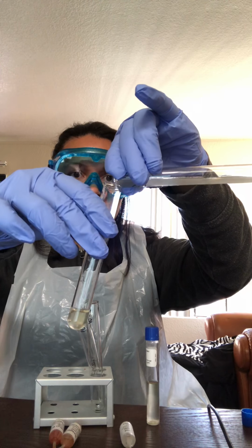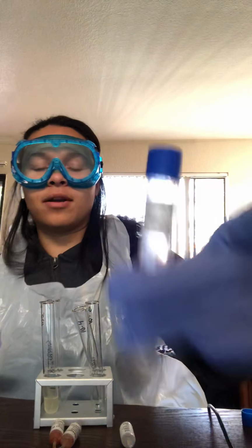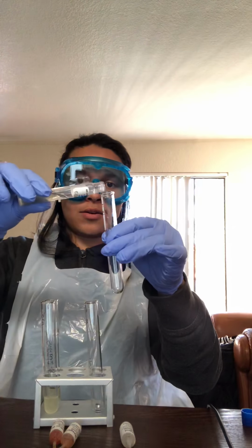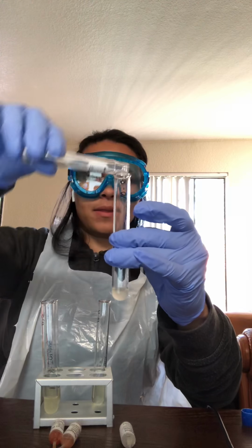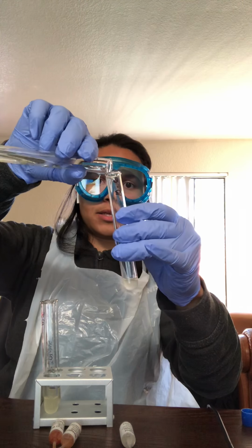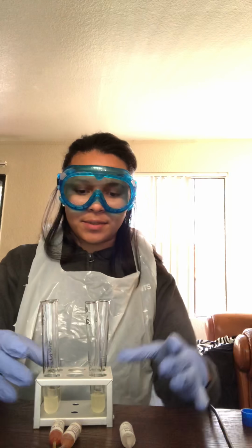And we're going to do the same thing with the E. coli. So I'm trying to get half here, doing the best that I can. Half and half, perfect. Now we'll do the E. coli from our MRVP. Let's go ahead and do the E. coli half. Oh, that's way more than half. I'll make it even here. Pour it in there. That's like nothing. And we're going to make this half. These are also labeled E. coli, as you can see, and S. epidermidis here.